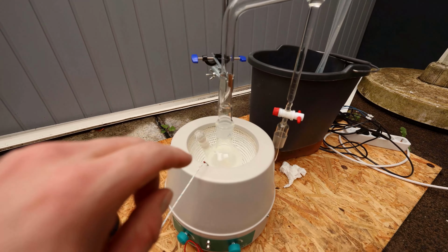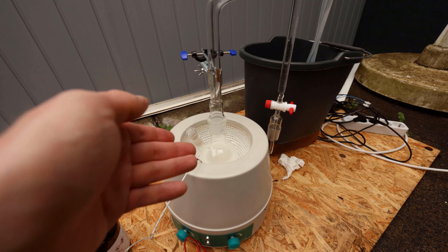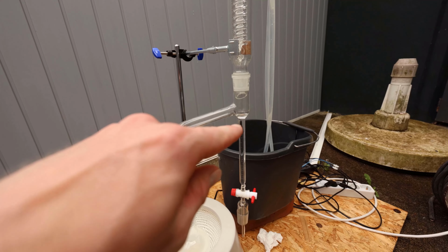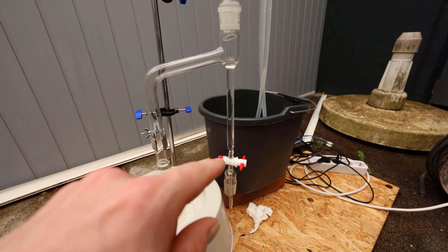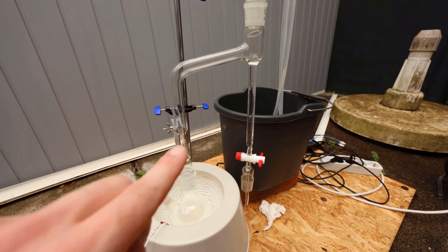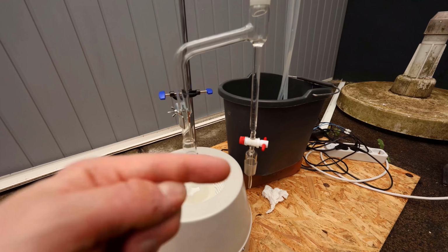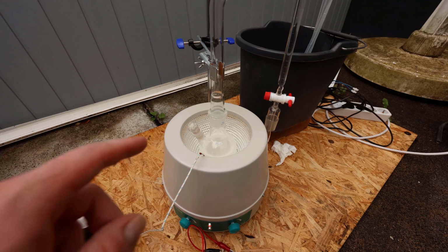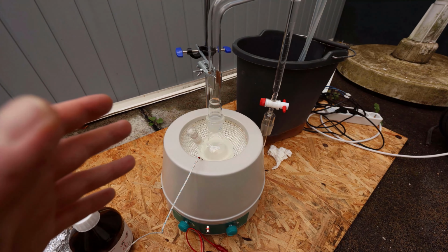The way this works is the reaction will generate water and it will boil with the toluene over into here, condense by the condenser, and drip down in here. The water is denser than the toluene and will sink down, and the toluene will stay on top and flow back into the flask. This way we separate out the water from this reaction and drive it forward. Unfortunately this reaction is supposed to take 12 hours. I have no idea how I'm going to do this because it's already late afternoon.